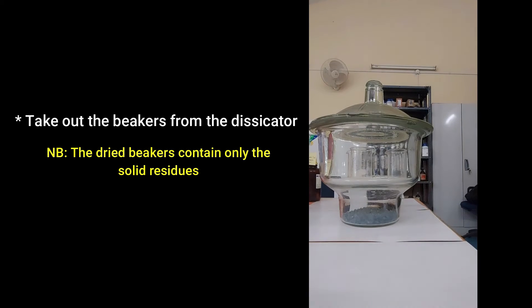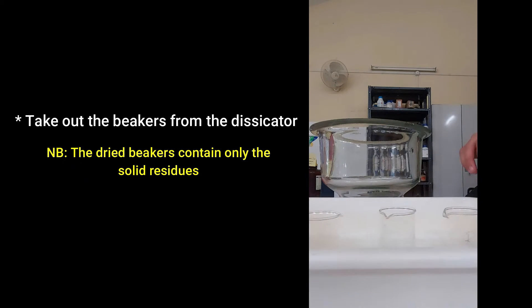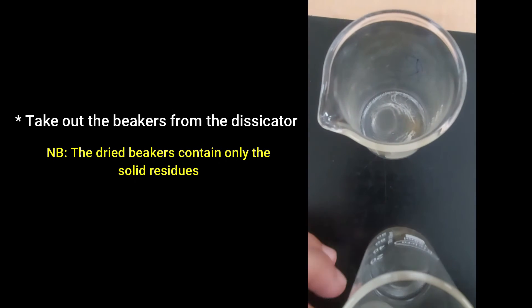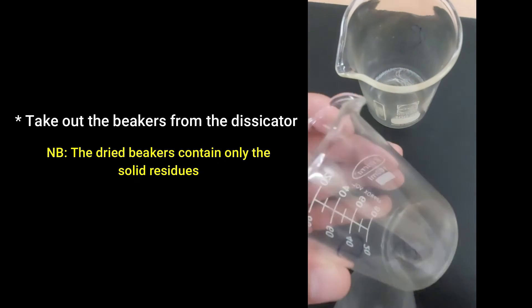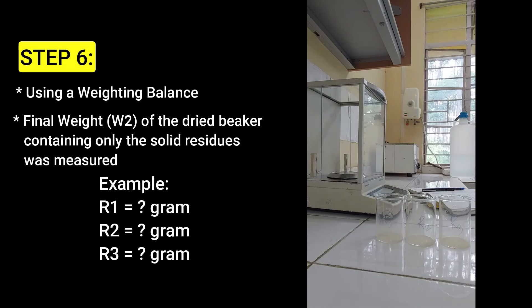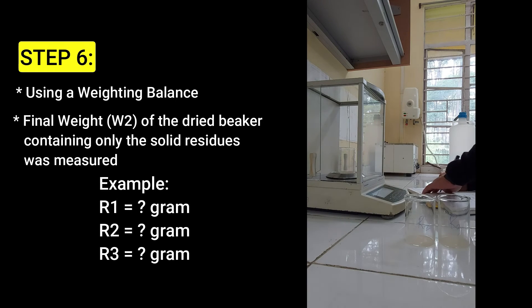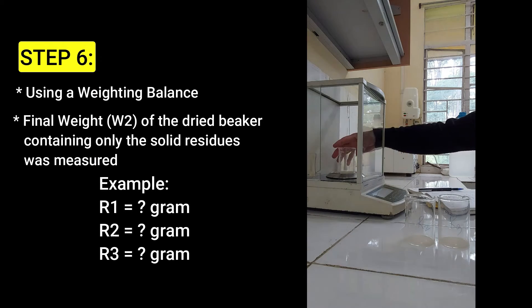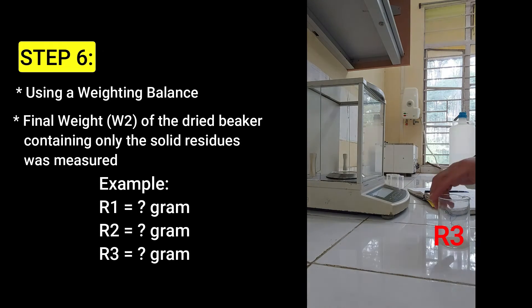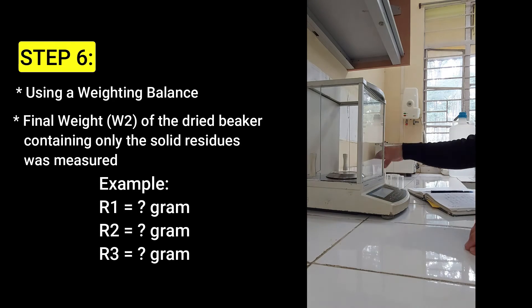Remove the beakers from the oven and keep them inside a desiccator for some time. Then take out the beakers from the desiccator. You'll see that each beaker contains only the solid residues, and the amount of residues depends on the content of dissolved solids present in the water. Then, using a weighing balance, measure and record the final weight of each dried beaker. Repeat the same for all multiple samples. The estimation part is now completed.